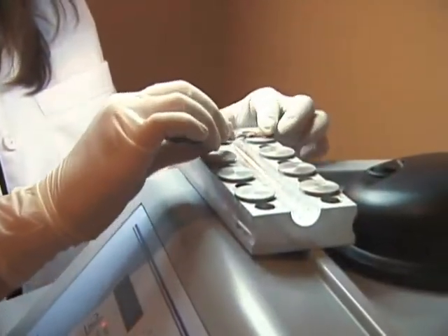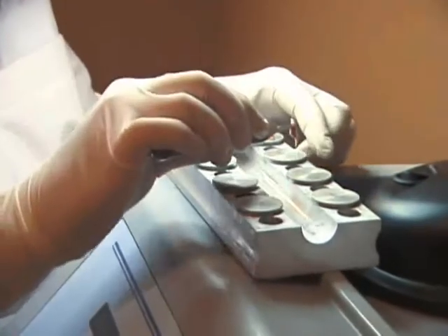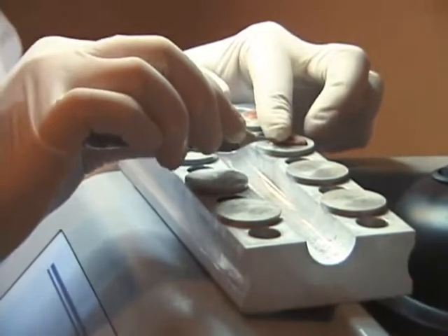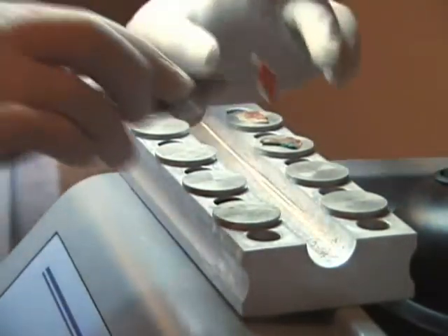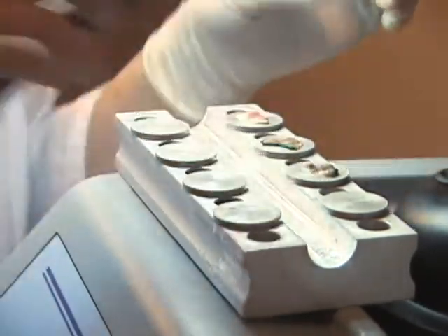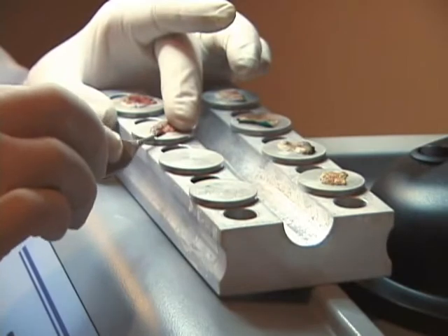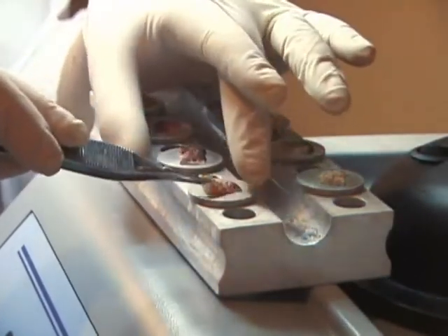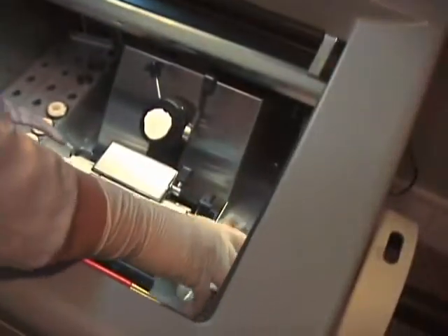The mass of this piece of equipment will retain its temperature for long periods of time outside the cryostat chamber, however, only moments are needed. All eight of these pieces can be viewed at eye level and easily turned to see all sides. Even when demonstrated slowly for teaching purposes, all eight pieces are oriented and frozen in just over one minute. It will take another two minutes to assembly line embed them.